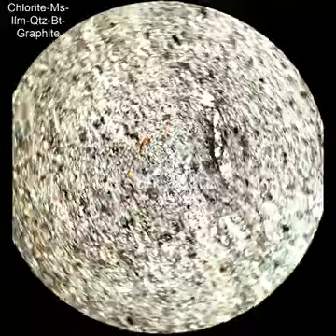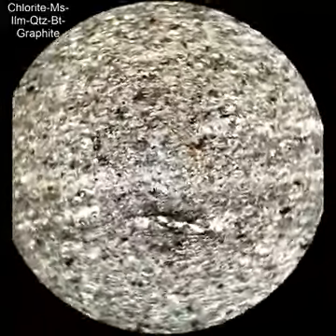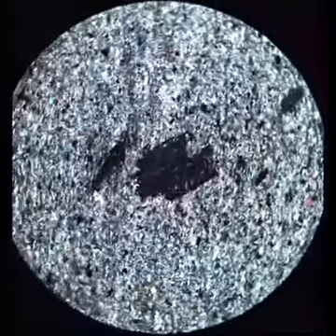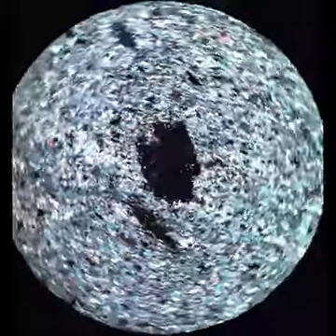Now this is chlorite in a graphitic schist, and you can probably only barely see it. There is a little bit of pleochroism, but when you cross the polars it becomes very obvious because of its distinctive interference colors. So it's right there, it's this sort of bluish color. Now the more iron-rich chlorites are bluer with interference colors, the more magnesium-rich ones are browner.